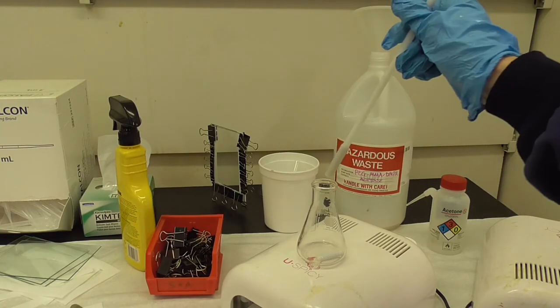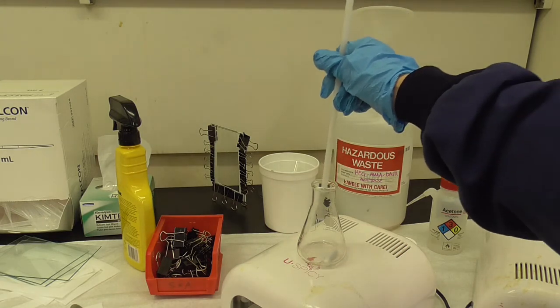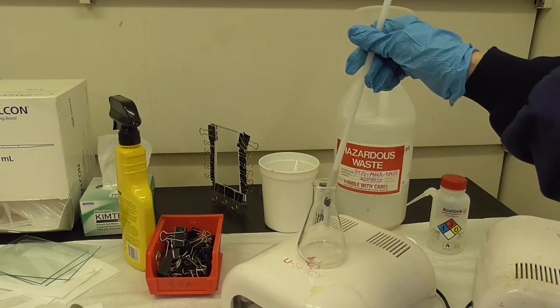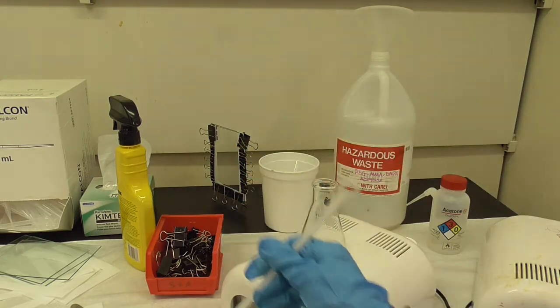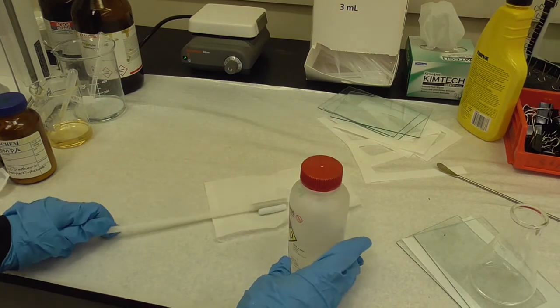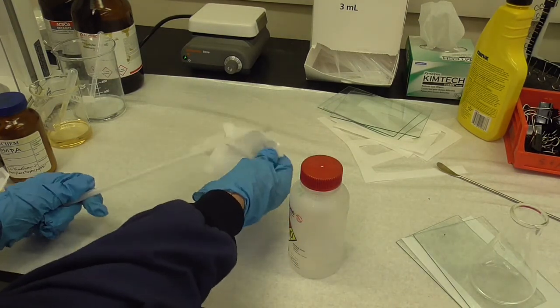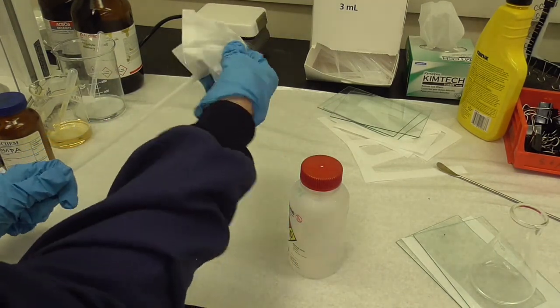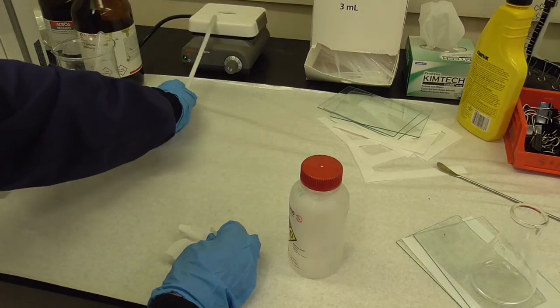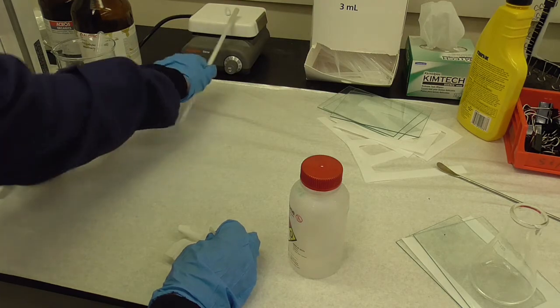On our leftover monomers here we have a magnet for removing the stir bar. I'm also going to rinse my stir rod with acetone and put it here for my next run.